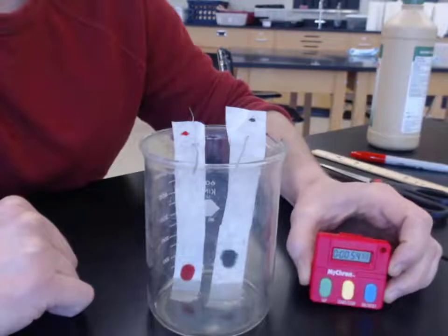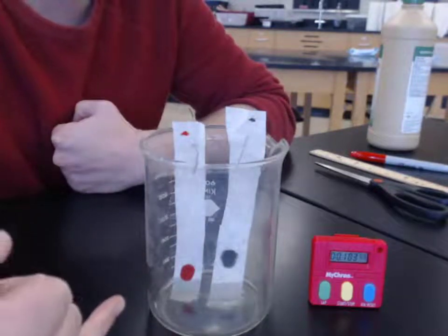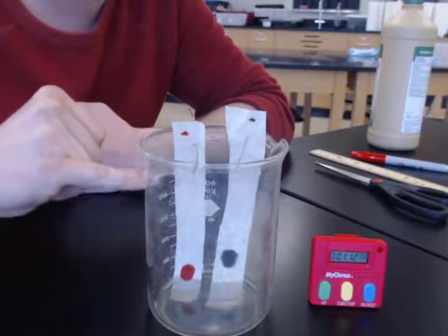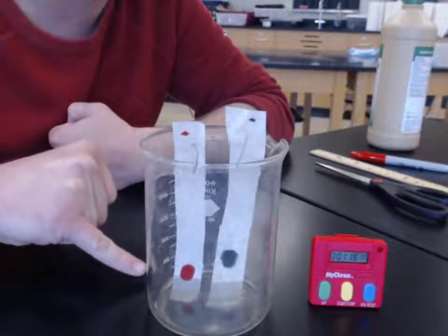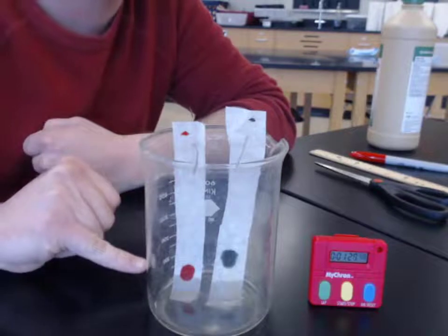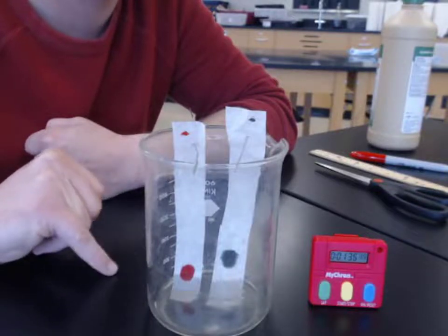We could record the time and say, okay, at this point our isopropyl alcohol is proceeding up the filter paper, but it has not yet made contact or done anything to the ink. The ink remains the same, looks the same. And you can add a little sketch to that showing that this portion of the filter paper is still the original white, and you have a slightly different coloration down there at the bottom where the isopropyl alcohol has already wetted the paper. As it continues to climb up, you can see it's encountering the red dot first, just because it's lower on the paper. But anytime we start to see any differences, we can record a new time.